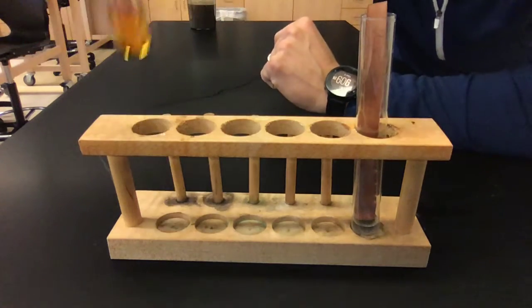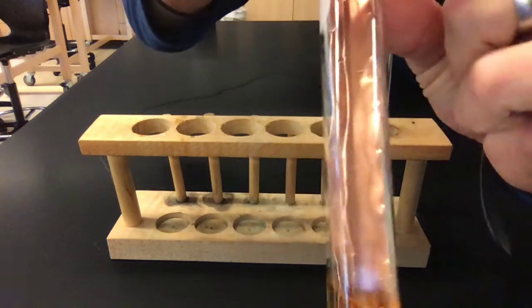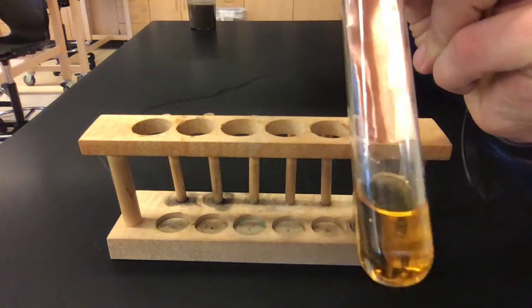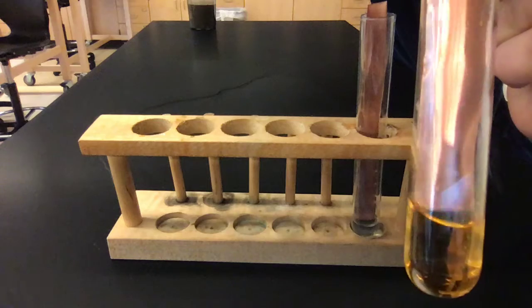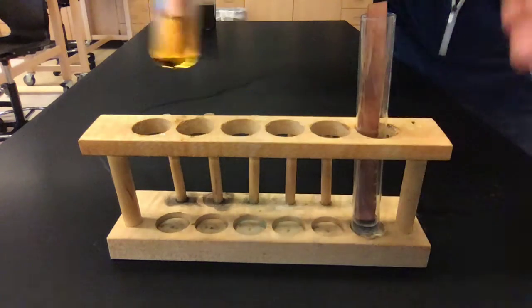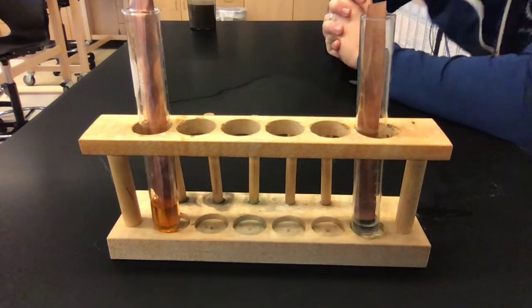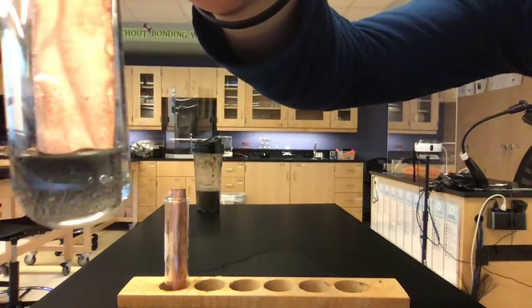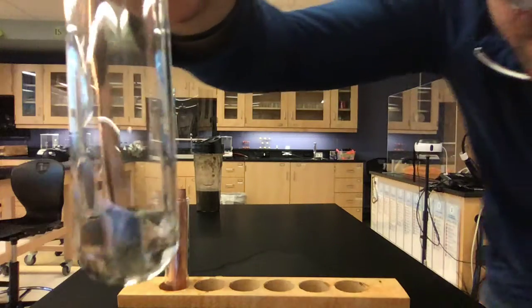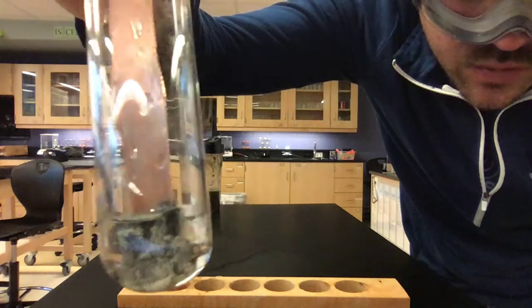Interesting. Let's check back in over here. I've got the copper and the iron. If I go ahead and pull the copper out of the solution, it's kind of hard to see because of the glare, but I still don't really see anything forming on my copper. So we'll put it back in there, maybe take a few more seconds to see what happens while we check back in with the silver nitrate and copper. This is actually really interesting. I'm not sure you can see, but look at all of this dark, almost fuzzy material that is forming right there. I wonder what that is.